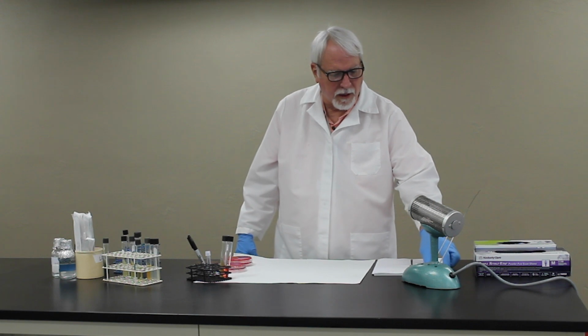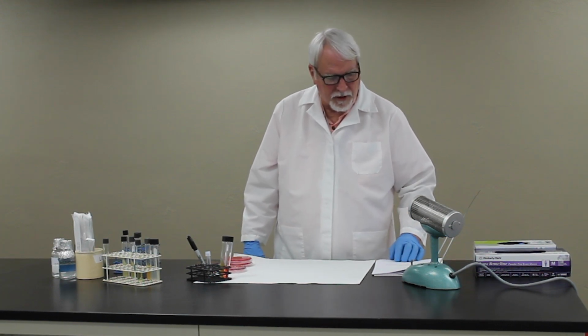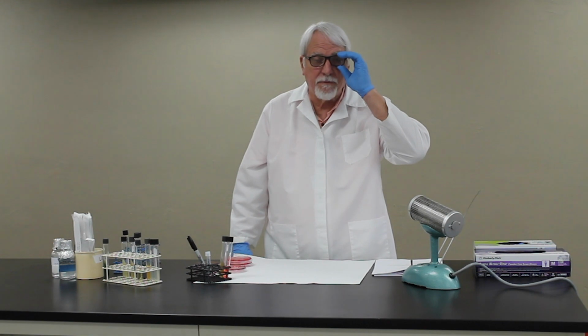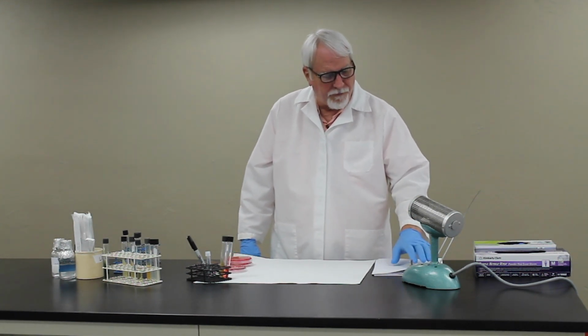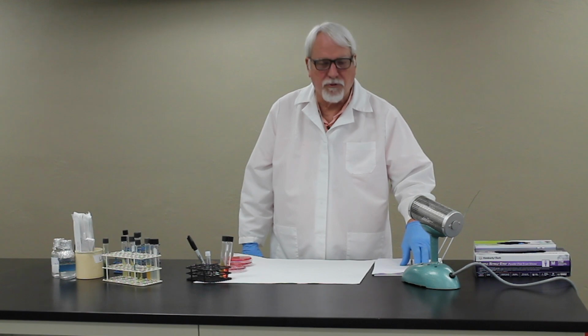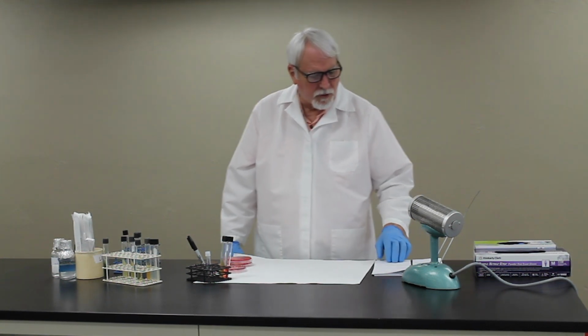Okay, so we're going to be talking about unknown number 4 in this segment. This is the gram-positive cocci, and we'll be looking at differentiating the Staphylococci from the Streptococci. You'll get 4 cultures of staph, 4 cultures of strep, and then an Enterococcus faecalis. And we'll be taking a look at those organisms.